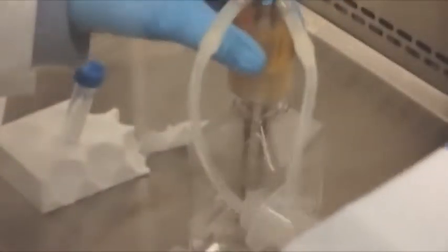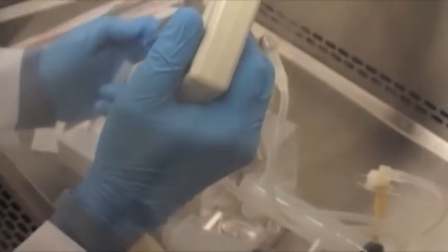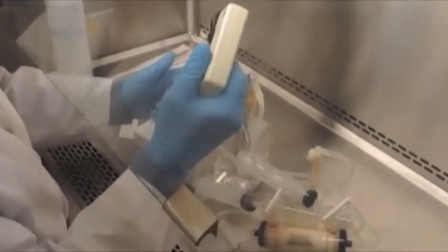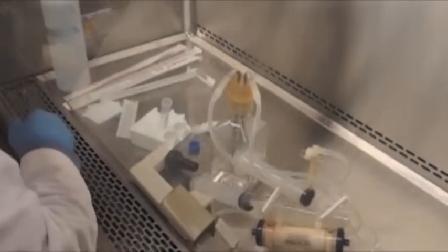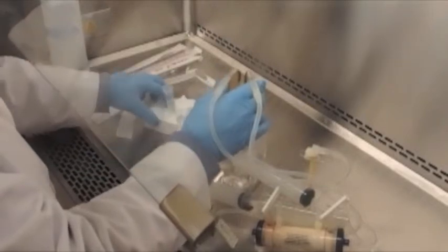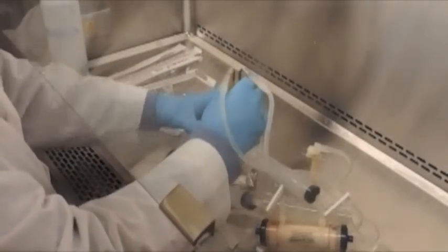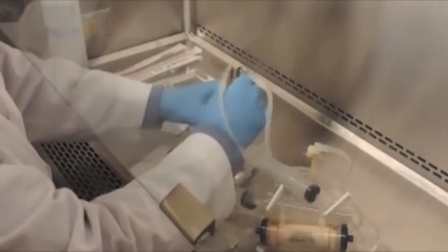When the glucose rate is above 1 gram per day, or 1 to 1.5 grams per day, then we want to utilize the high glucose rate harvest and harvest cells from the cartridge. When the glucose rate is 1 gram per day or less, then we want to utilize the low glucose rate harvest when harvesting product and cells from the cartridge.